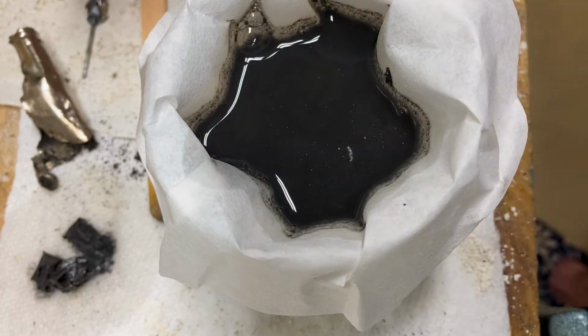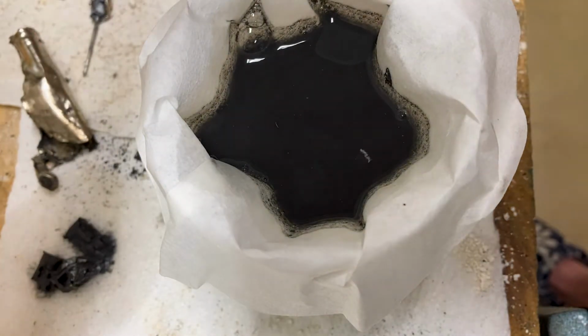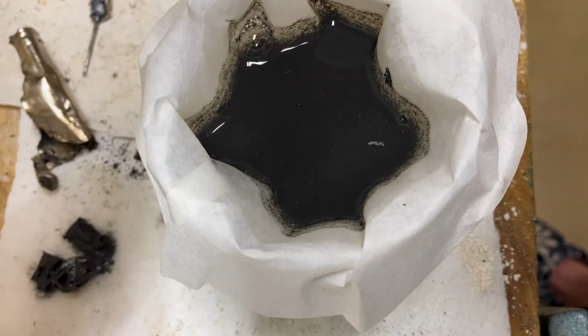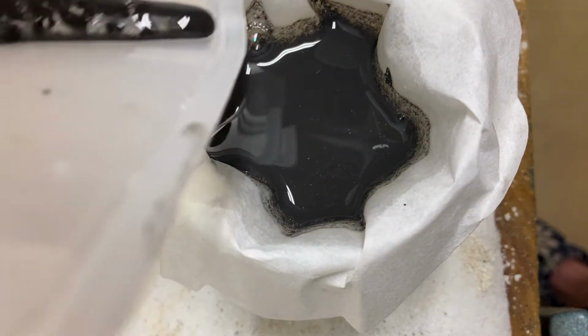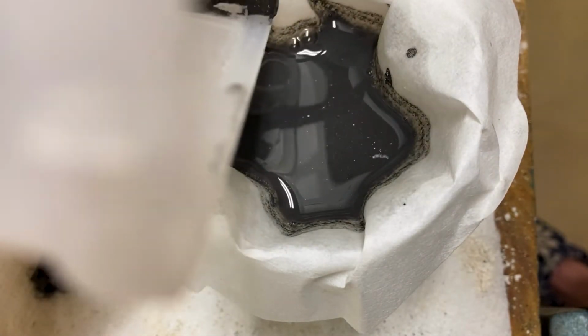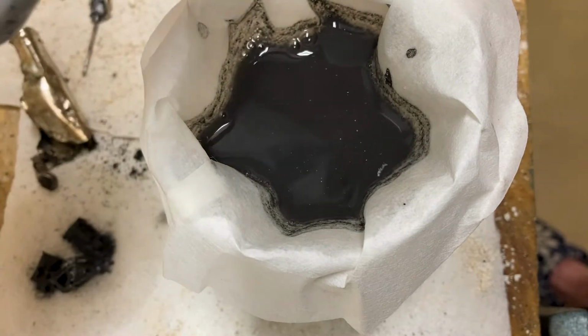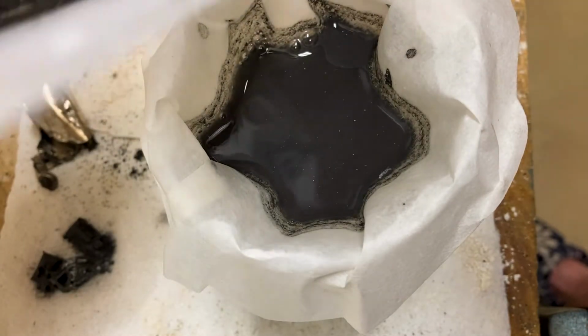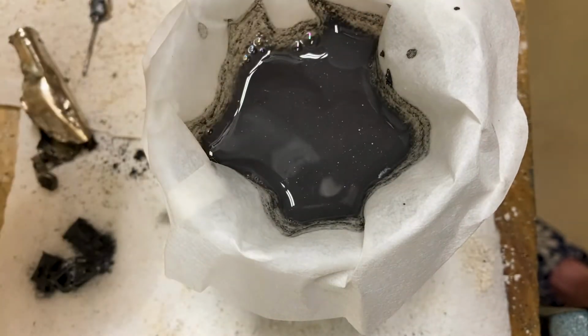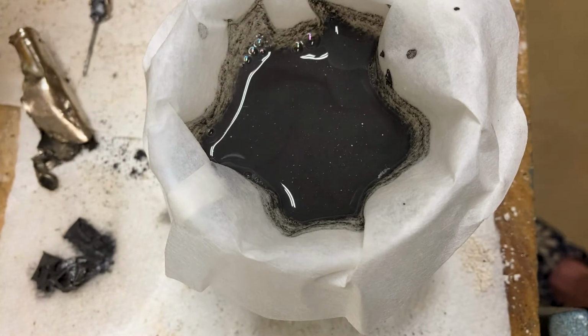And I got a lot more in the container still that I think I want to get over there. I think a lot of this is more the manganese oxides than the zinc oxide. And I'm trying to think of what I can do with the manganese oxide.